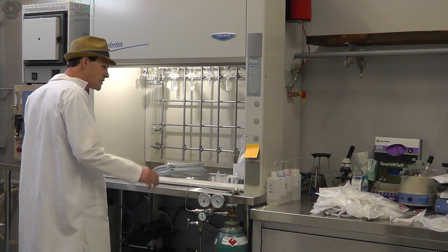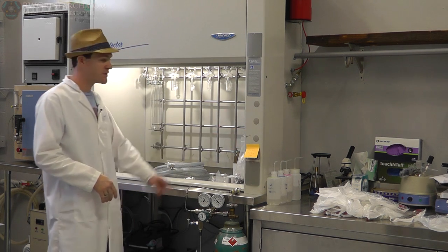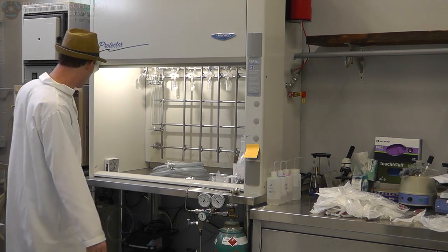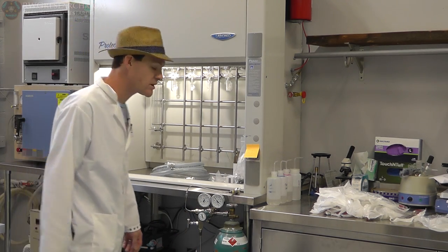I think the only thing I don't have, we don't have these valves. I may wait to publish this video until I have those. We've got a heating element, we've got a whole bunch of stuff. So I think we're just gonna sort of go through it, see how this video goes, and yeah, sit back, relax, and enjoy.